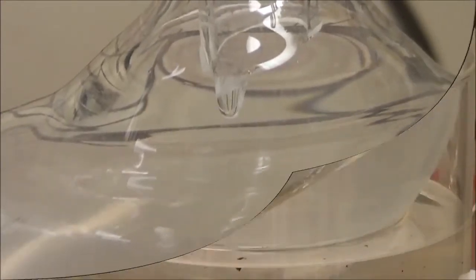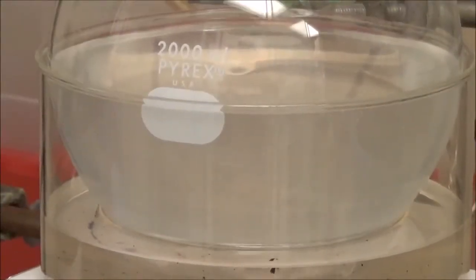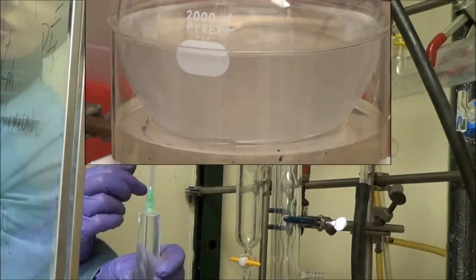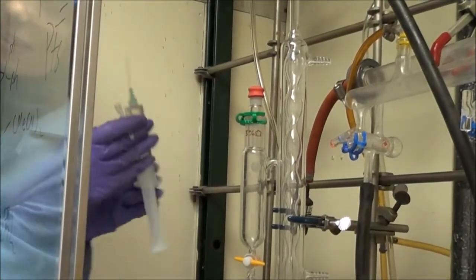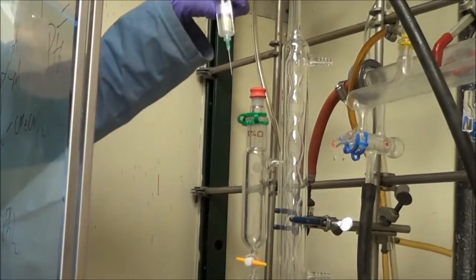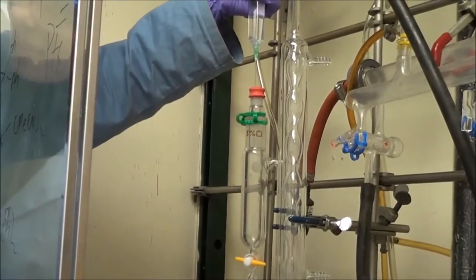I don't like to work with a very violent reflux, and you can see that by how slowly the hexane is dripping from the condenser. After about three to five hours, you can see that the sodium has reacted. That little bit of whiteness there is probably some sodium hydroxide, because we probably didn't have completely water-free solvent.